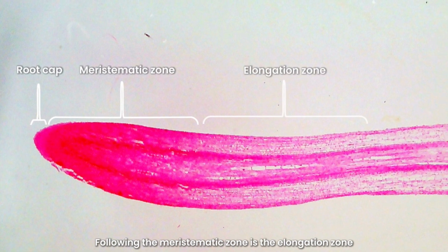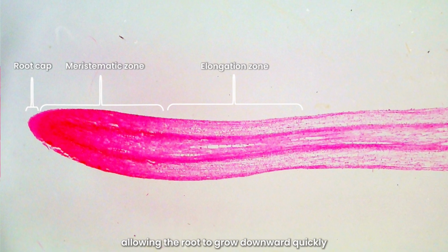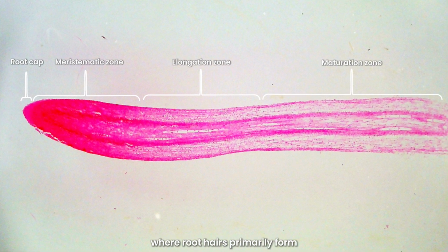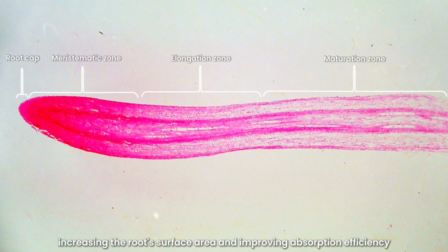Following the meristematic zone is the elongation zone, where cells rapidly elongate, allowing the root to grow downward quickly. Finally, we have the maturation zone, where root hairs primarily form, increasing the root's surface area and improving absorption efficiency.